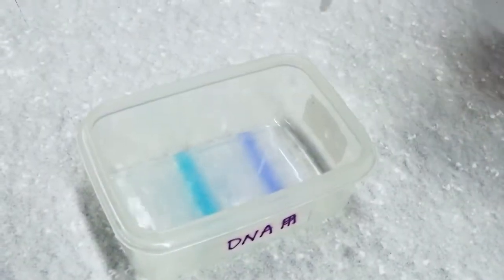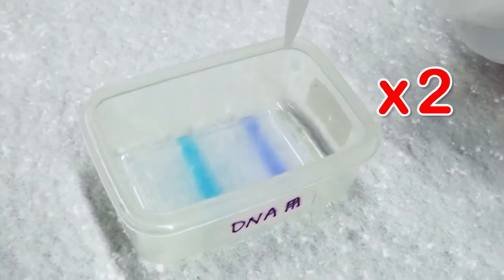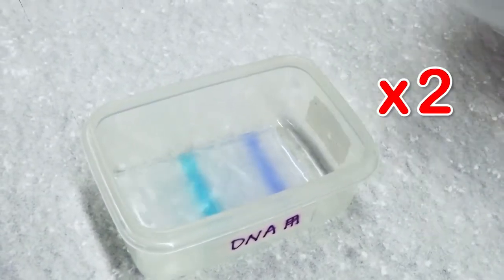If the loading buffer contains a nucleic acid staining dye, wear gloves to remove the gel carefully from the tray and place it in a clean box. Wash the gel twice with distilled water to remove salts.